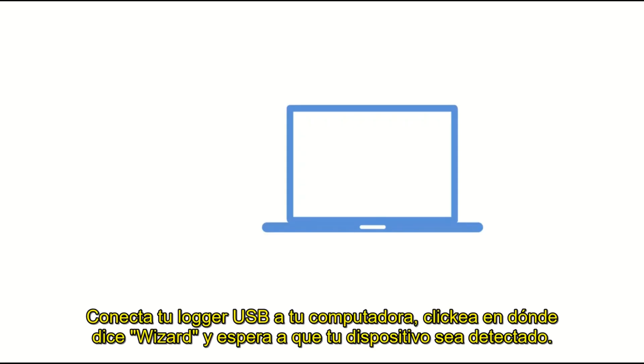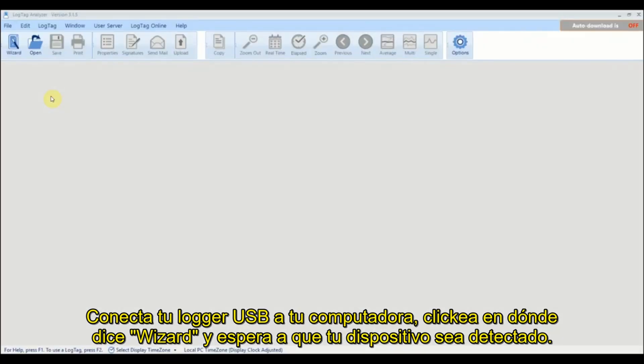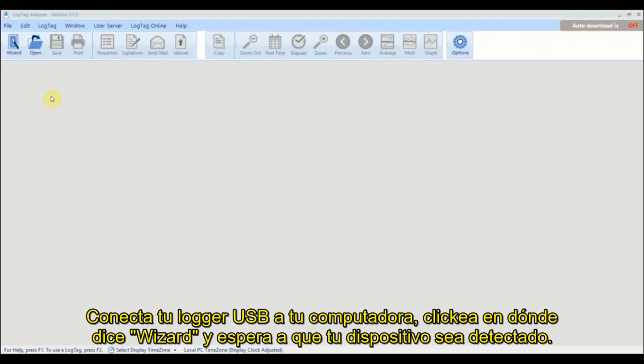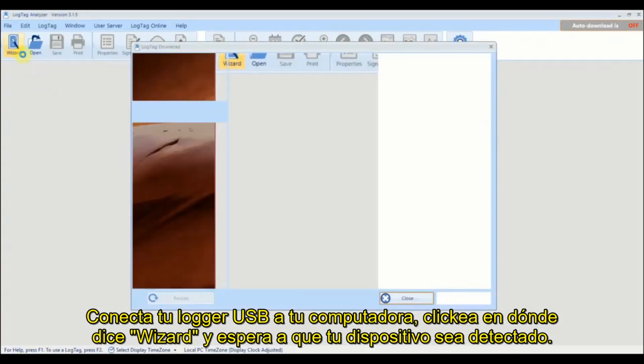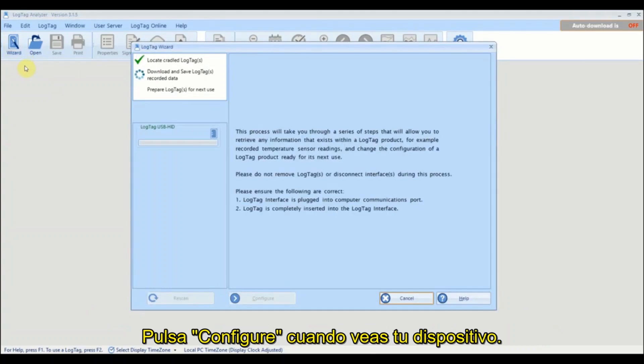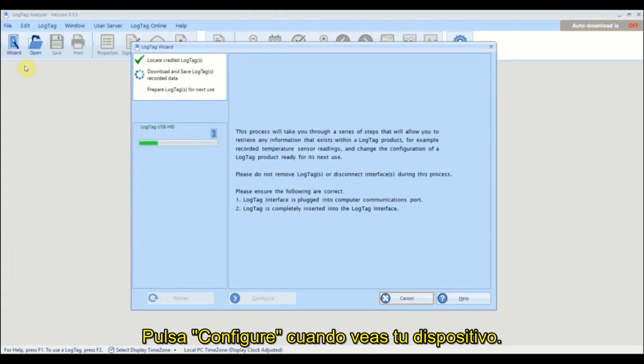Connect your USB logger to your computer. Click on the wizard icon and wait for your device to be detected, then click Configure once you see your device.